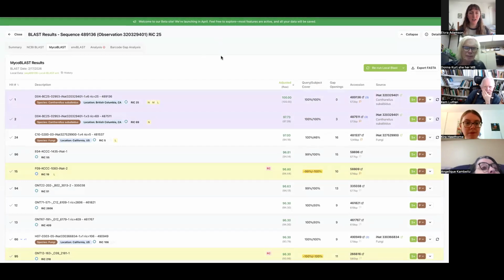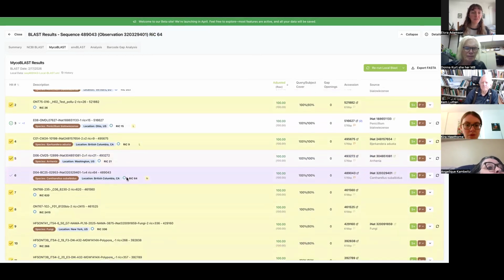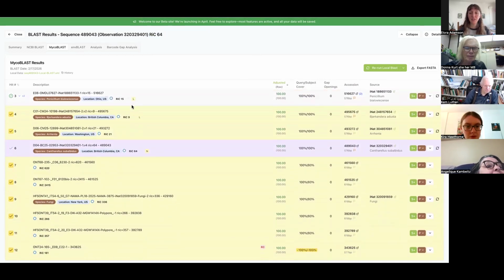I'm recording this to show an example of how I would deal with something that has so many associated sequences. The first thing I'm going to do is go through all these blast searches and see if there's one that stands out as having the most reads in consensus. 25 is pretty low. 64 is a bit better. But actually, okay, one of those was 2606 reads.